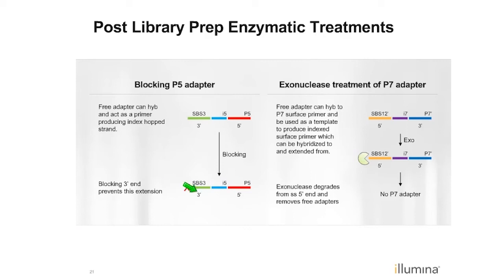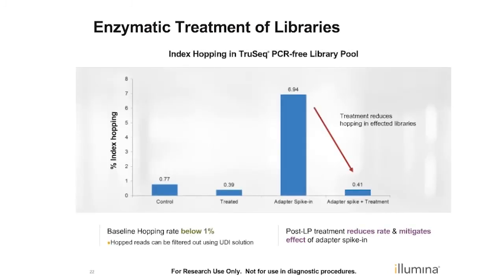So a combination of both exonuclease treatment and a blocking chemistry we find also works really well in controlling this hopping, keeping levels low, even in cases where you don't necessarily have the opportunity to use unique dual indexes. So for instance, let me show you an experiment where we started with a PCR-free library, and generally got 0.8% as the control. If you treat with one of these enzymatic protocols, you can knock it down even lower.